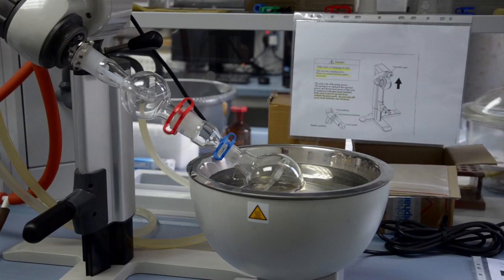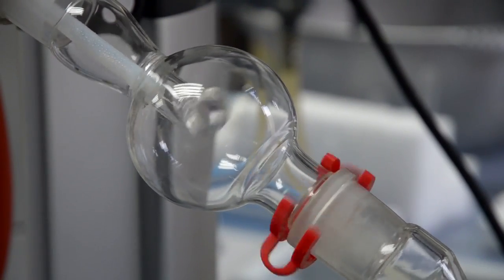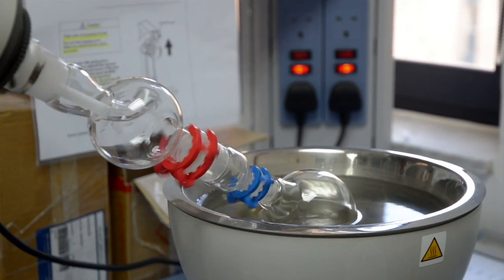Be sure to avoid too high a vacuum as this will result in bubbling of the solvent and could cause splashing of the reaction flask mixture into the rest of the apparatus.